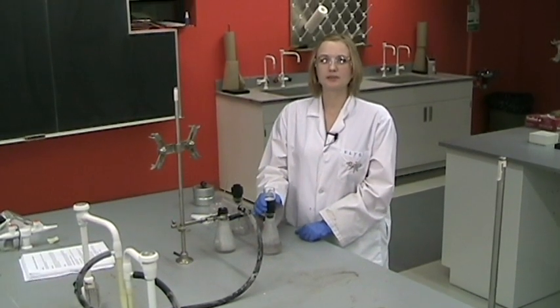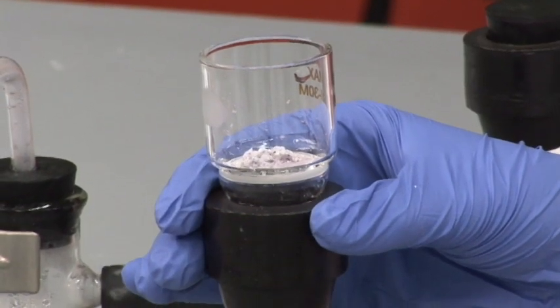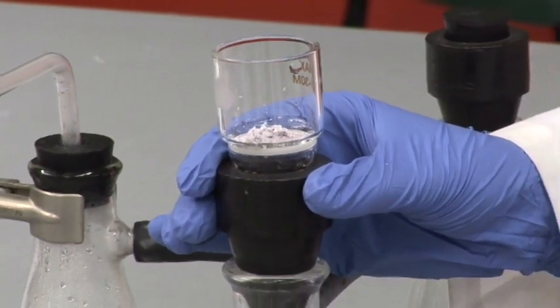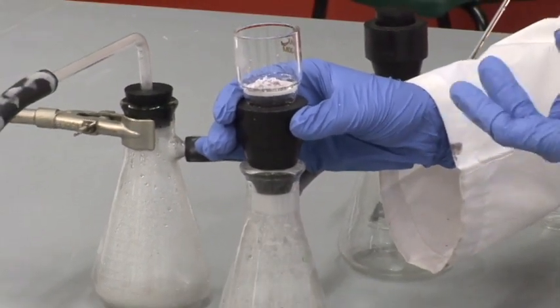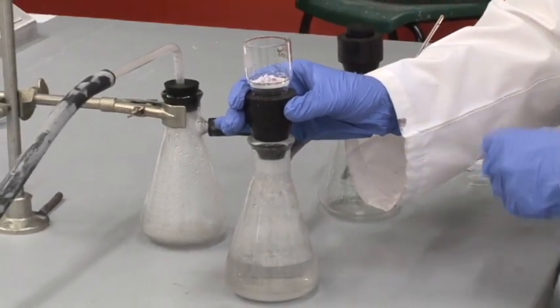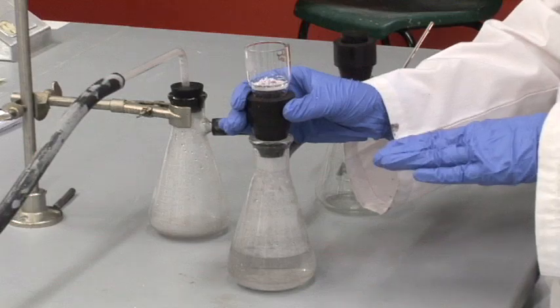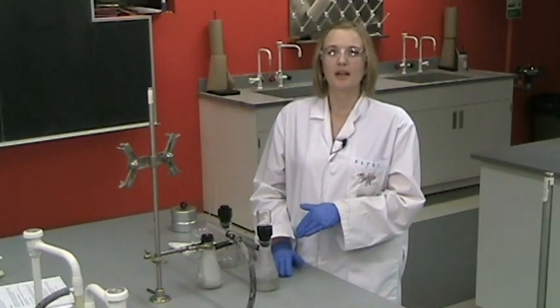You'll be simply testing the water by adding a few drops of hydrochloric acid. So as a source of chloride ion, if there was any excess silver dripping through the crucible, you would see a precipitate form as more silver chloride is formed in the washings. If nothing is formed, there's no excess silver, and you're ready to do the final rinses of the salts on the filter.